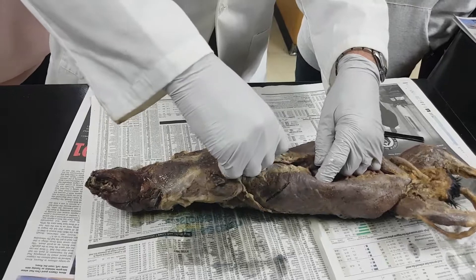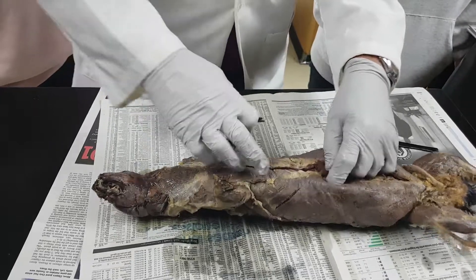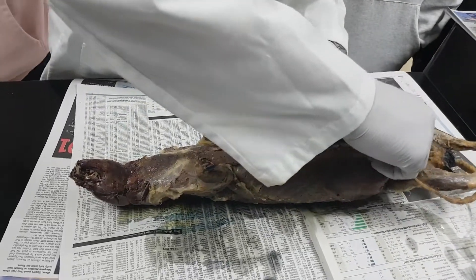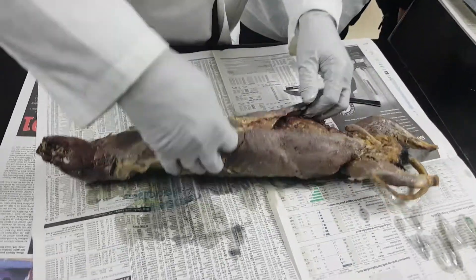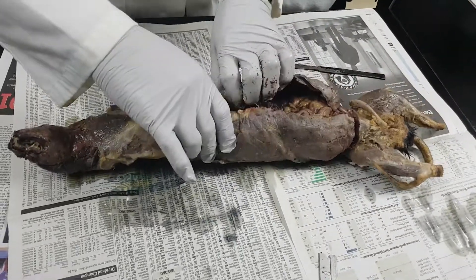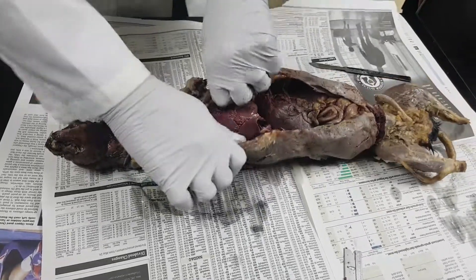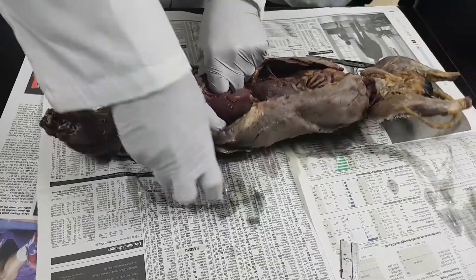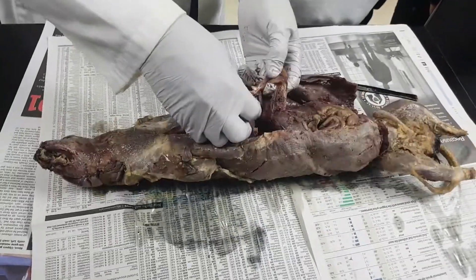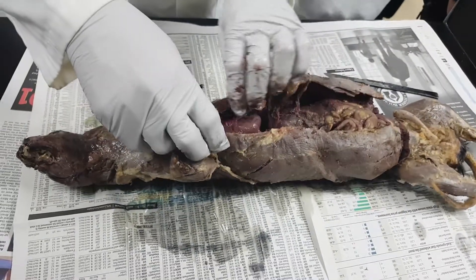You're going to be able to see the diaphragm. Now I'm going to cut from side to side — you can see the guts. Listen to the bones crack. You see this fiber right here going across? That's the diaphragm — that helps you breathe. Everything above that are the lungs and the heart.